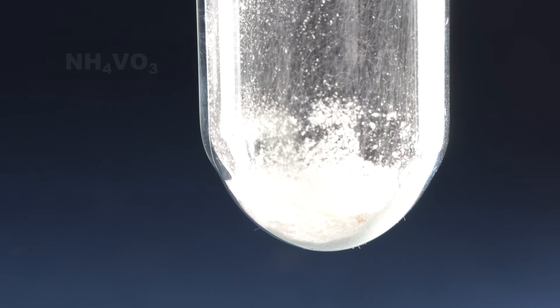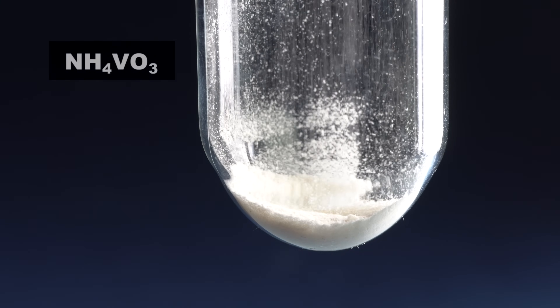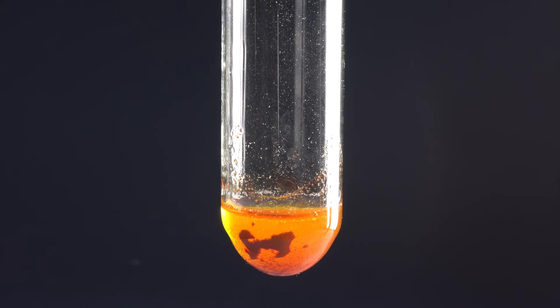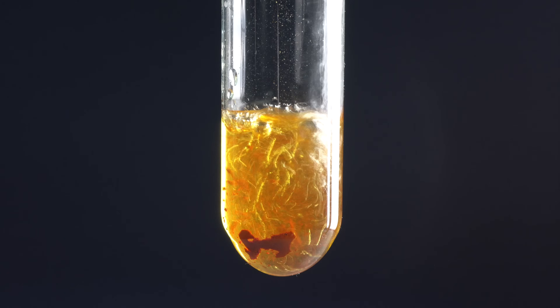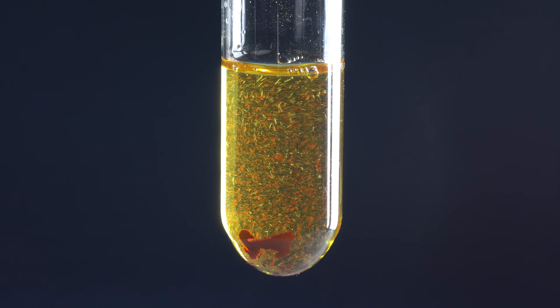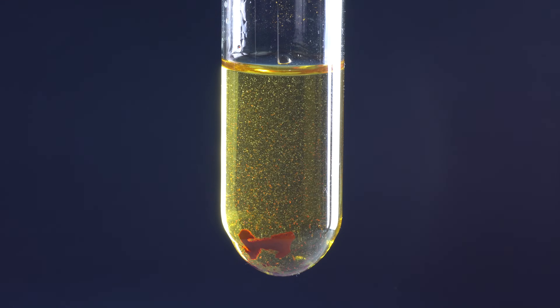For this reaction, let's take a little of ammonium vanadate, a substance used as a catalyst in organic synthesis. We'll add hydrochloric acid to ammonium vanadate, and due to this reaction, the so-called polyvanadate oxides are formed in the solution. By the way, vanadium oxide-5 is used as an effective catalyst in the production of sulfuric acid.